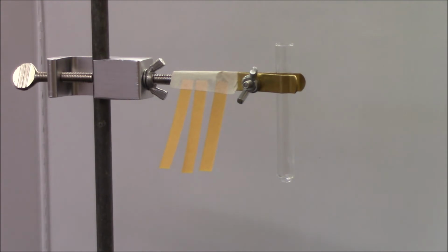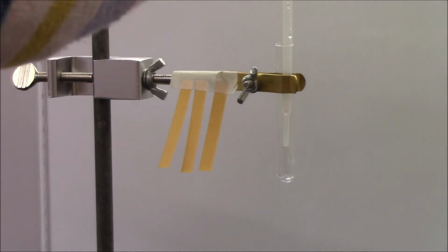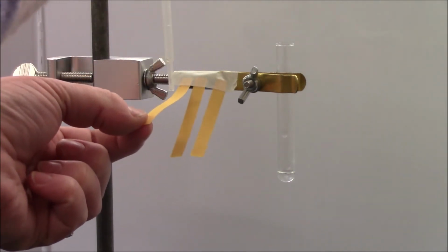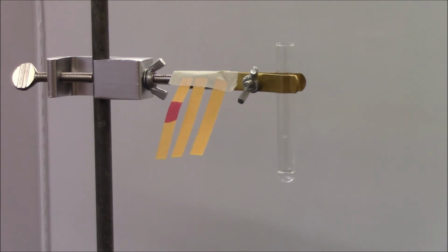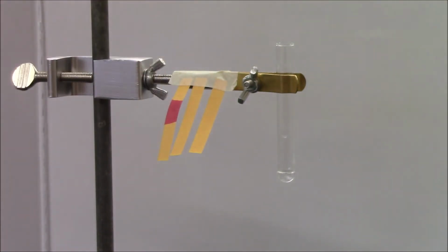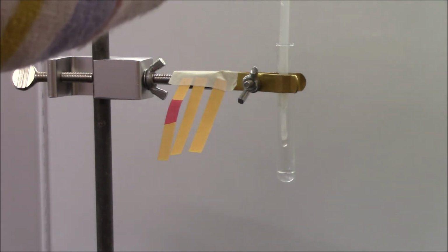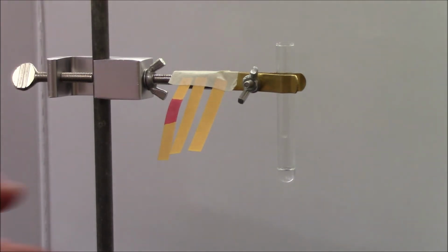So my acid, hydrochloric acid, it's here. It's transparent. It's clear. I'm going to add it to my test tube. Okay. And then I'm going to add a drop to my pH paper. All right. And what we can see is that it turns my pH paper pink or red. Sodium hydroxide. Sodium hydroxide is also clear and transparent. I'm going to add some drops here. 1, 2. I'm trying to add equal amounts of each. I don't know if I'm doing that or not. I'll also add a drop to my pH paper. Sodium hydroxide turns my paper blue.